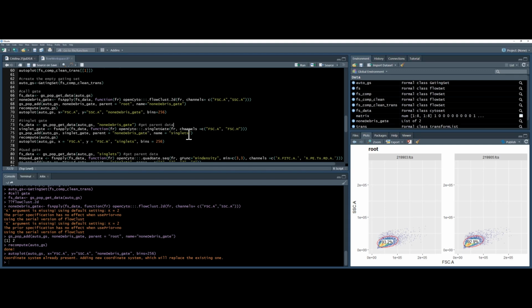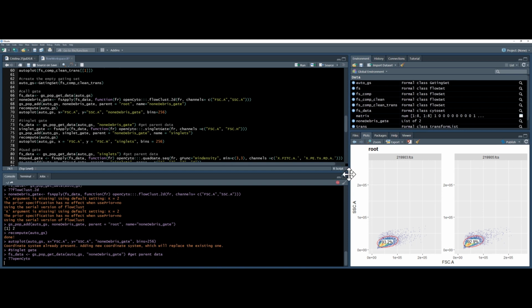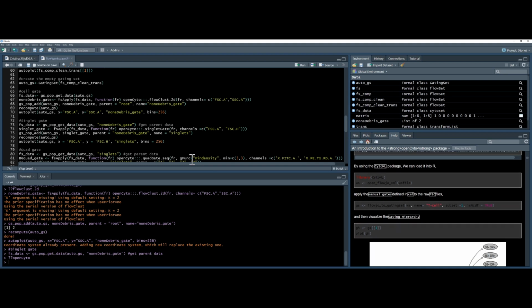I shouldn't digress. Next, we're going to do a singlet gate. So again, we're going to extract the data, but this time with only the non-debris gate. So not of root, but of the non-debris gate only. Create something called singlet gate, use fsApply, use a different function. So from OpenCyto, we're going to use singlet gate. If you want to know more about OpenCyto, you use the help documentation again, ??openCyto, and this will give you different ways of interacting with OpenCyto.